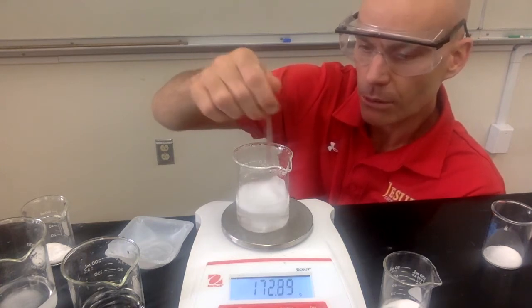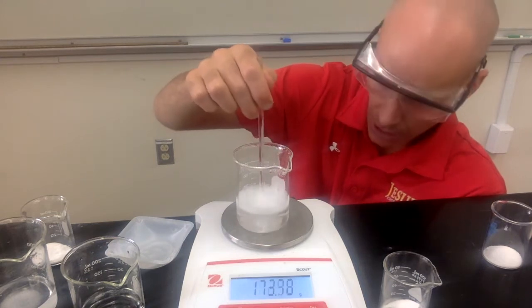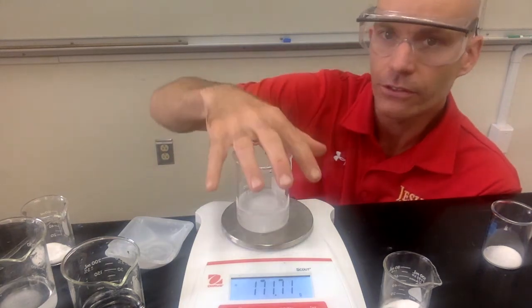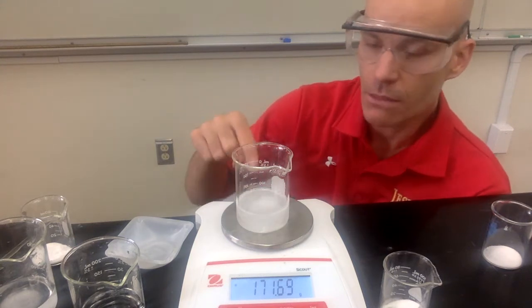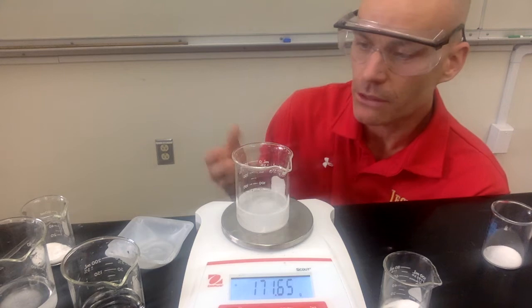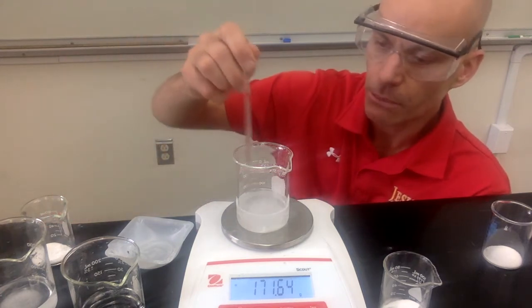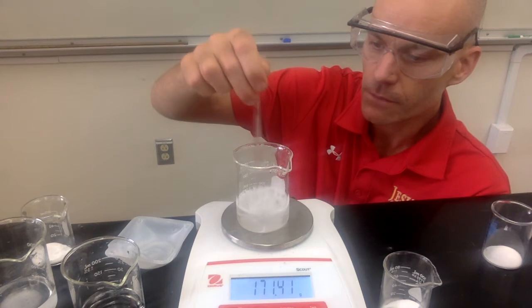And it's not because we broke the law of conservation of matter, but it's because a reaction took place, and during that reaction, a gas was produced, and that gas was carbon dioxide, and this is an open container, and the carbon dioxide was able to escape. So you can actually see the mass continuing to go down a little bit as those carbon dioxide bubbles pop, as they rise to the surface. The mass here is getting to be a little bit less and a little bit less. So we'll wait a couple more seconds for these bubbles to pop, and we'll record the mass.